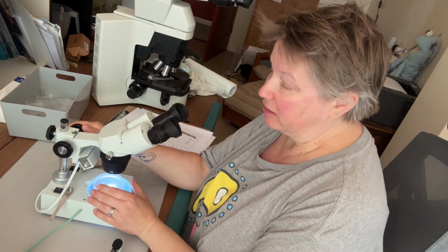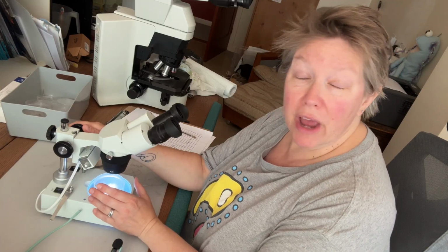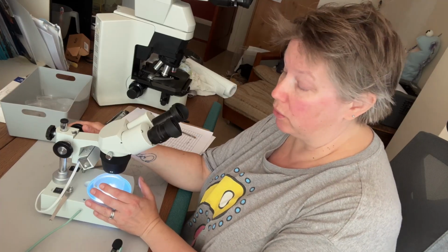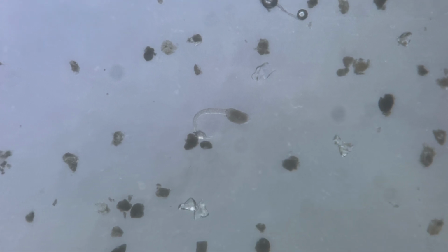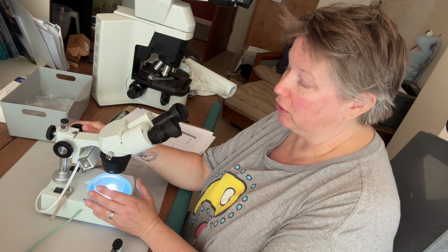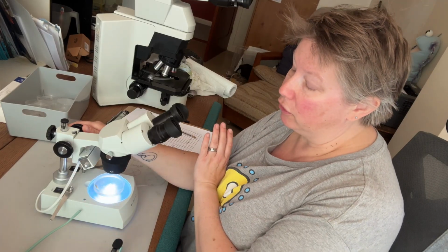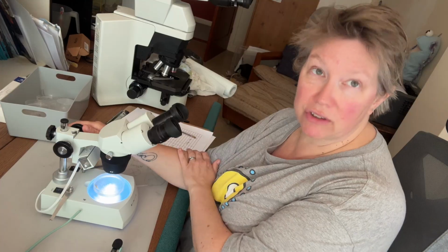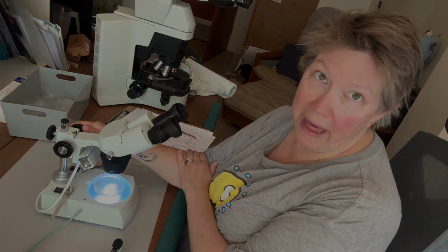Once you've noted down some of the more obvious organisms that are in your petri dish, you can start to check to make sure that you haven't missed any of the smaller organisms or less common organisms. So things such as diatoms or foraminifera, maybe sea squirt larvae are something that can quite easily be missed. So go over your petri dishes again and keep in mind looking for those organisms perhaps that you've not seen that are on the list, just to check that they are or are not there.